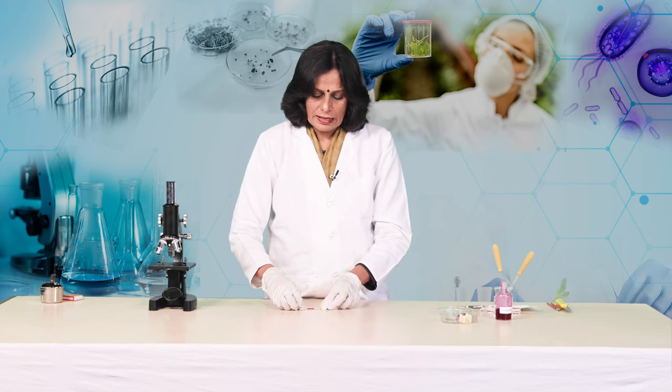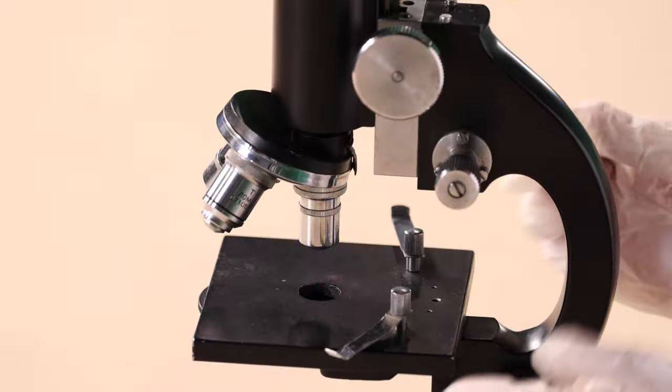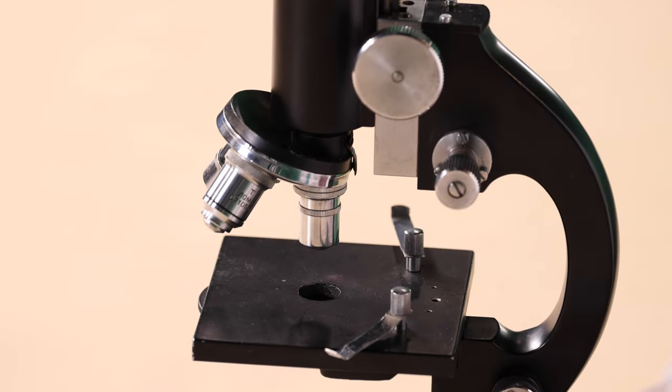This is done. Now, examine the slide first under the low power of the microscope and then under the high power.